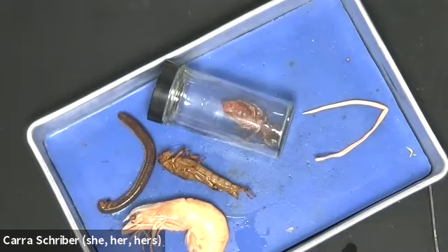We looked at a cross section of a flatworm or planarian. We looked at a cross section of the earthworm, and we looked at a cross section of the roundworm. And all of those were different both from the inside and from the outside. And so I just wanted to show you that, and hopefully when you watch this video, you're able to see those differences. So I really appreciate you joining me for this part.